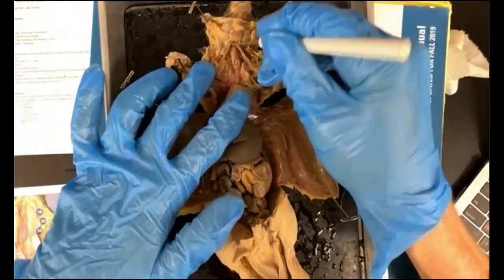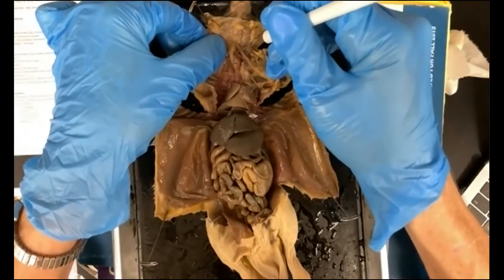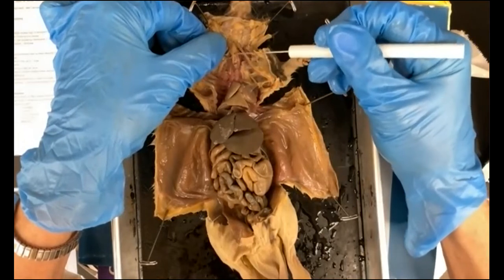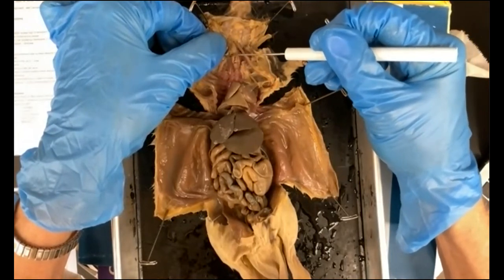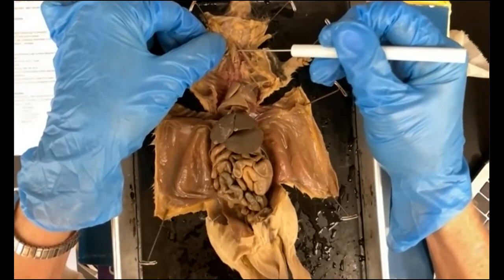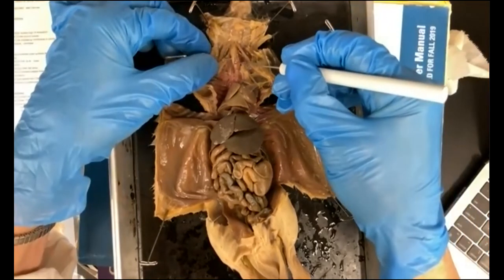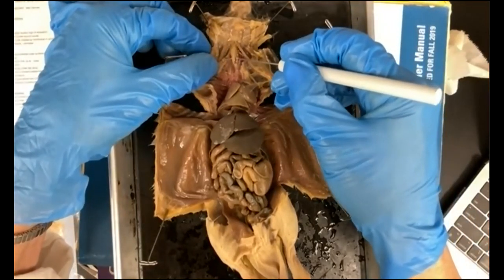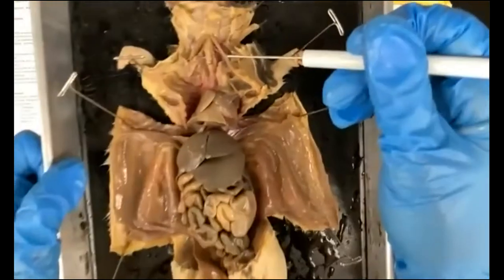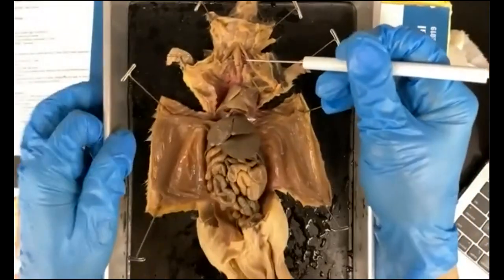The trachea, remember, you'll be able to feel the cartilaginous rings on the trachea, whereas the esophagus, you won't. So I'm just running my probe down here and I can feel these cartilaginous rings. So I know that that is this lighter color one here. That's the trachea. And I think I poked a hole in it. The one behind it, I don't know if you can see that, this one here, slightly behind it, that's going to be your esophagus.